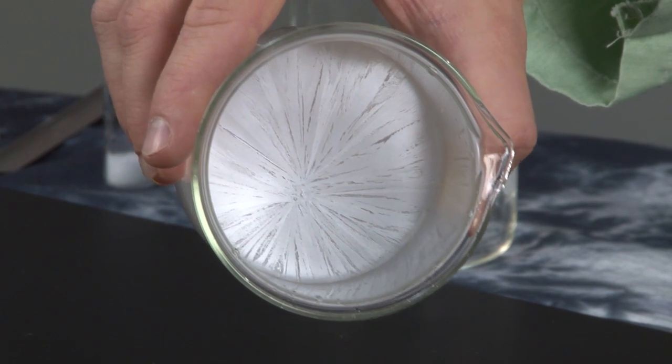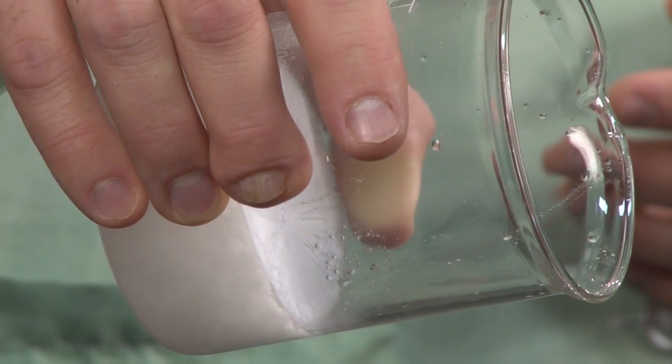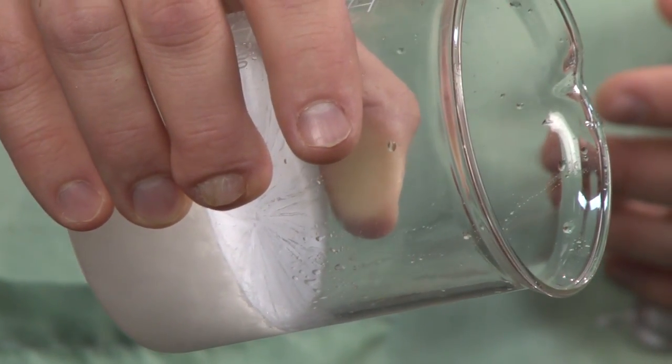Also, I'm touching this with my hand now. The outside of the beaker is warm because this process was an exothermic process.